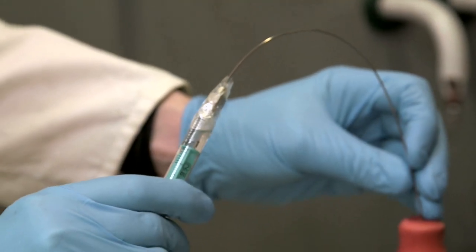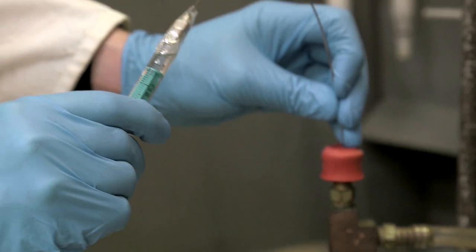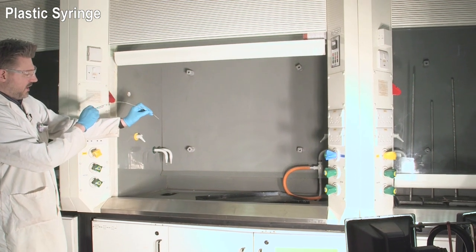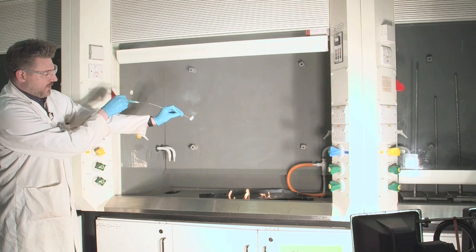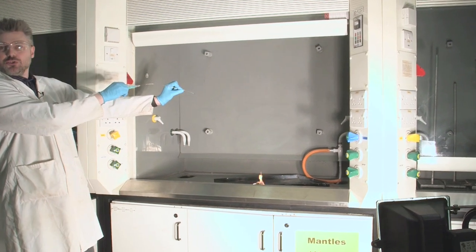This is diethyl zinc in this syringe, and as you can see it looks harmless. It could be water for all anyone would know. Okay, here we go. I'd say we got some blue.